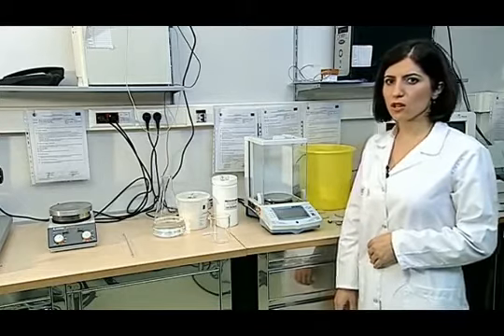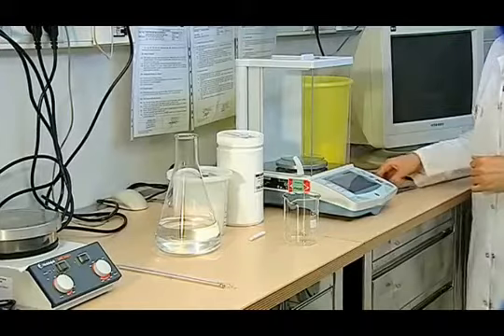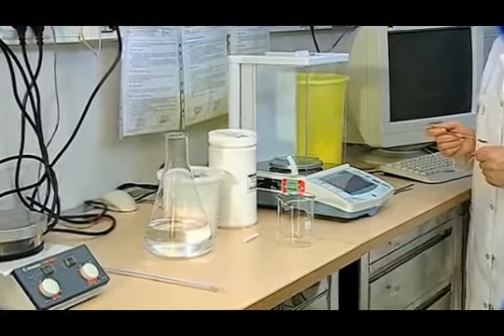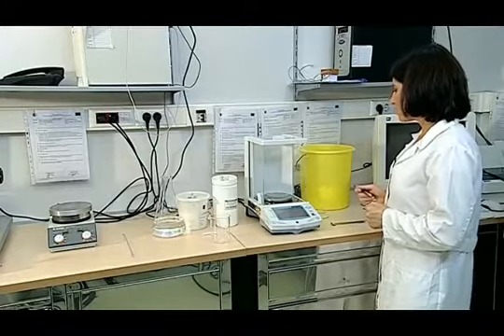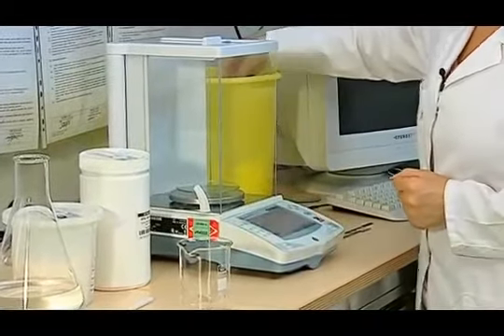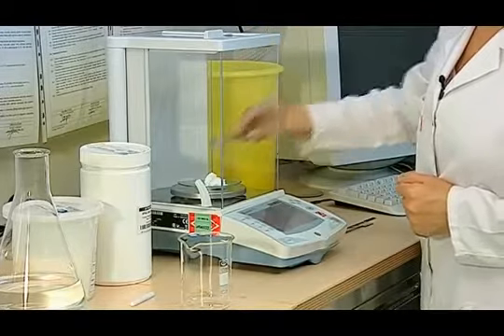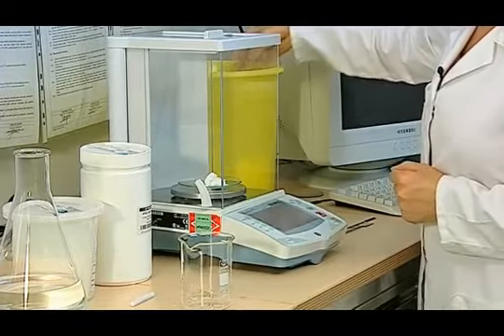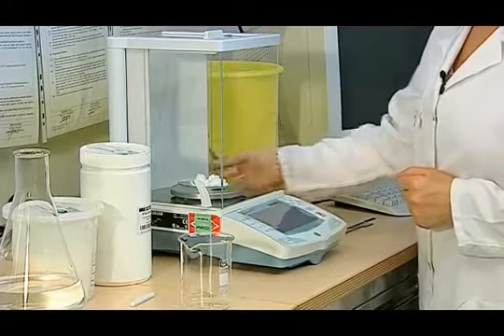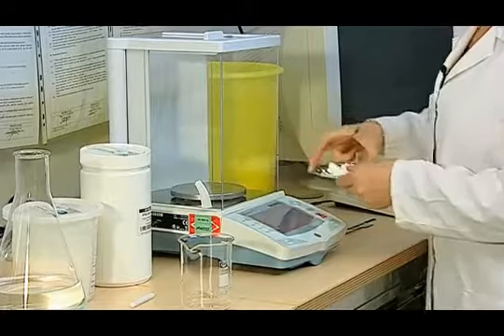We use 3 different detergents to obtain the detergent mixture that will be used in the dimensional change test in washing and drying. 77% of the 11.8 grams of mixed detergent solution is ECE detergent, and its weight is 9.09 grams. After reading the value on the screen, we put it into a beaker.